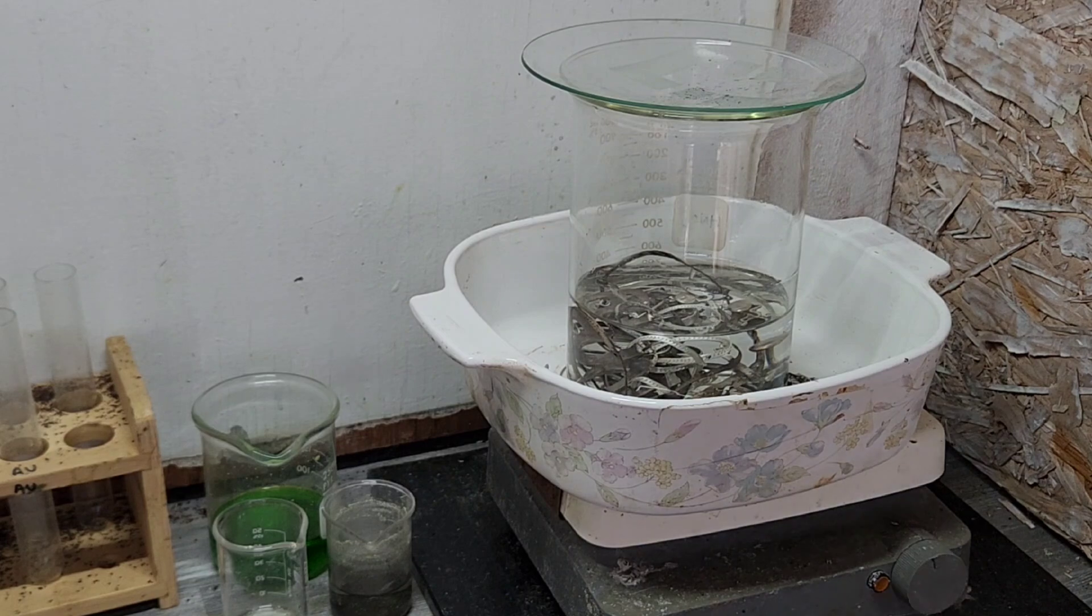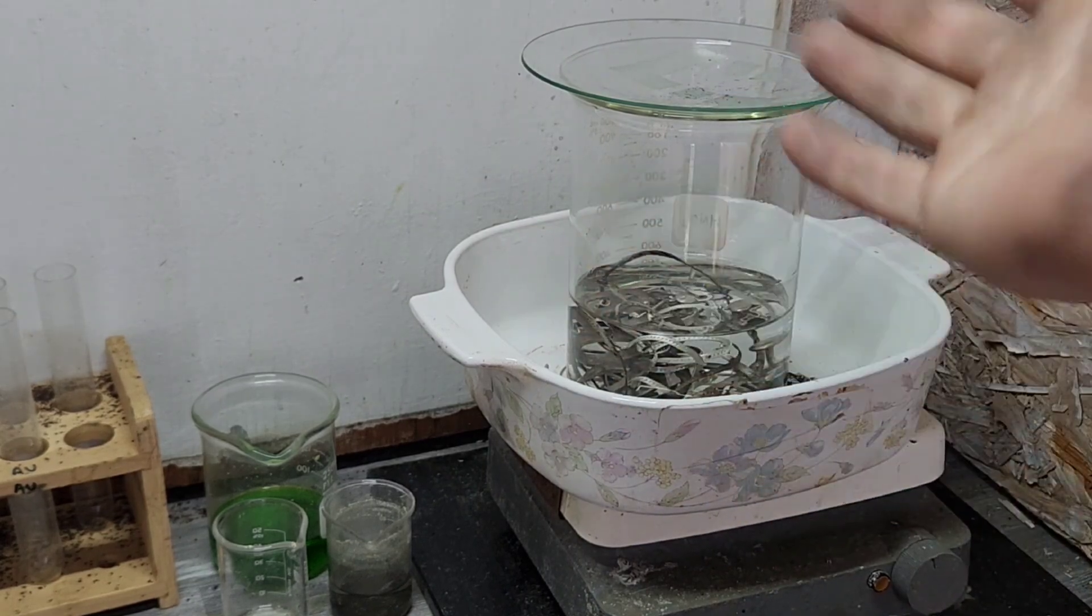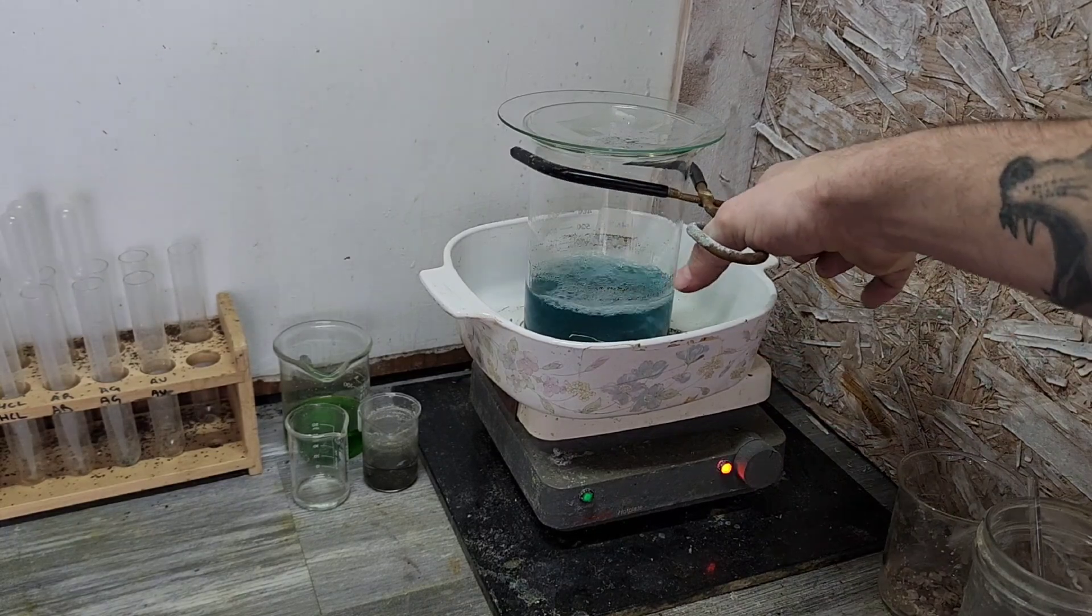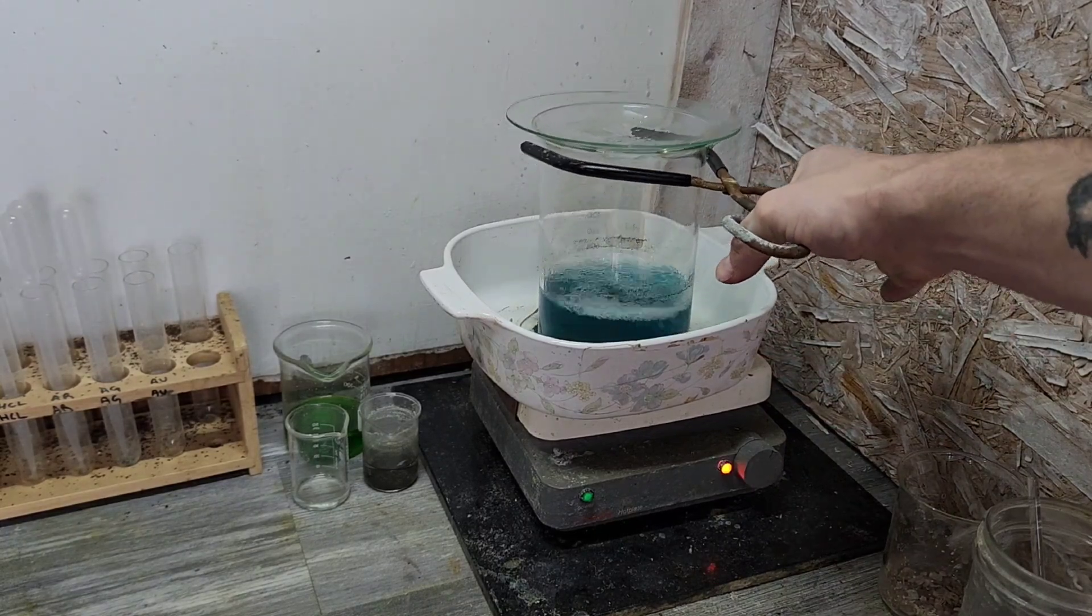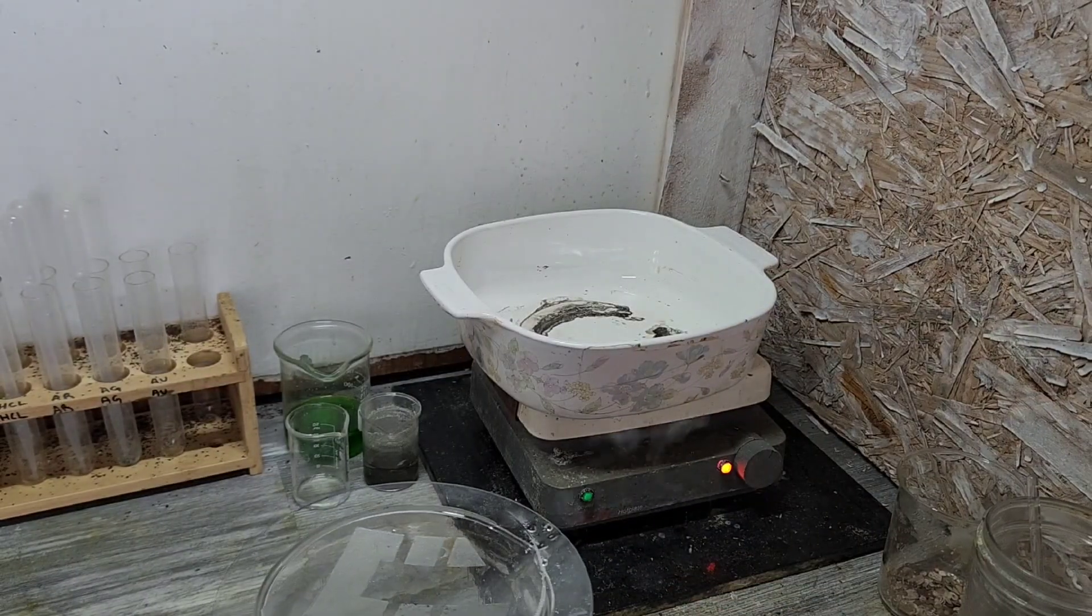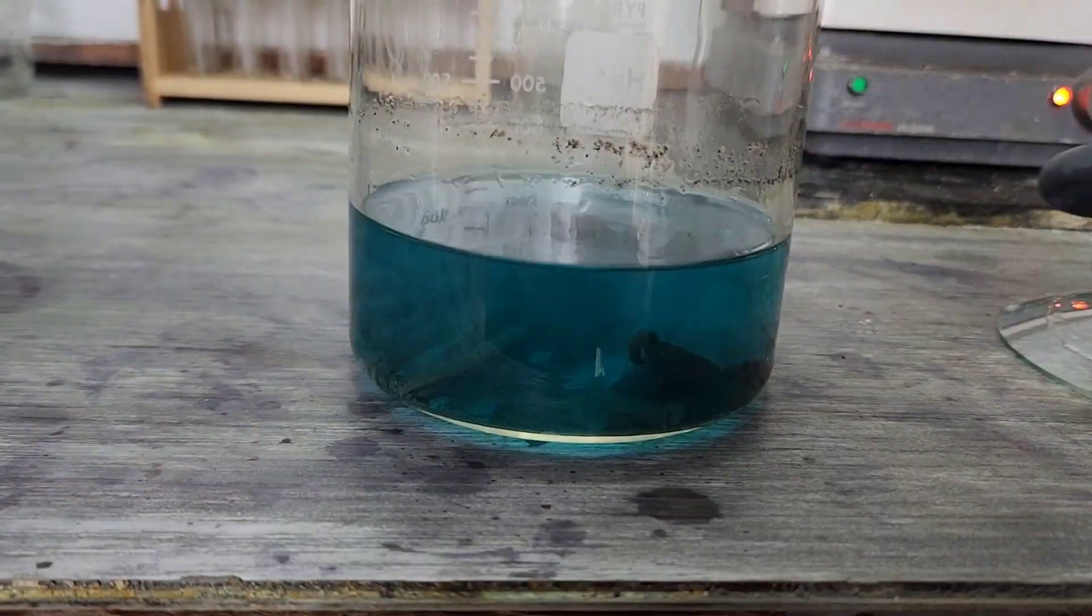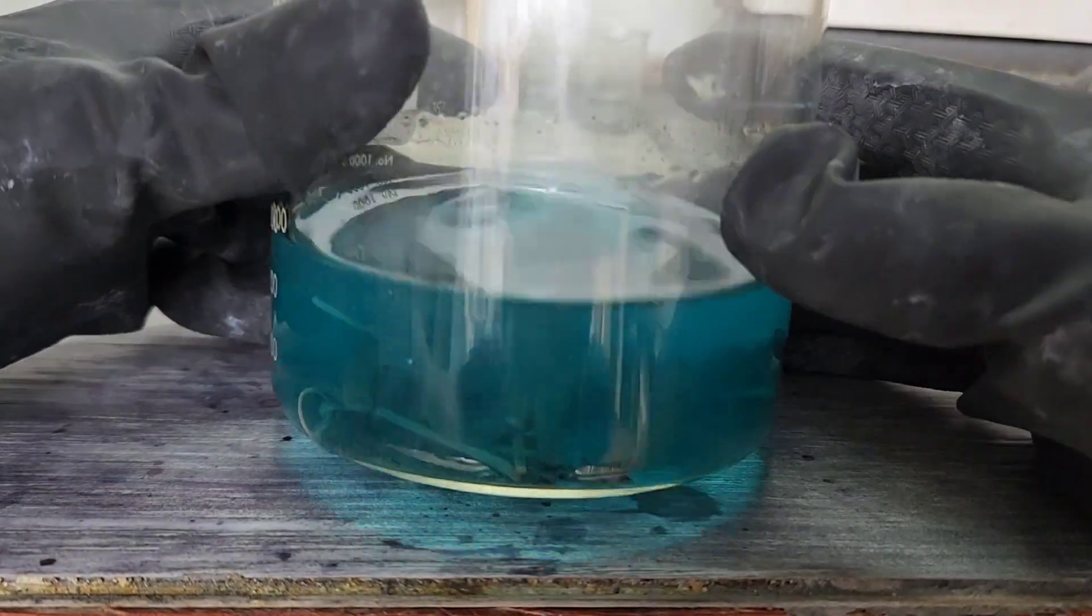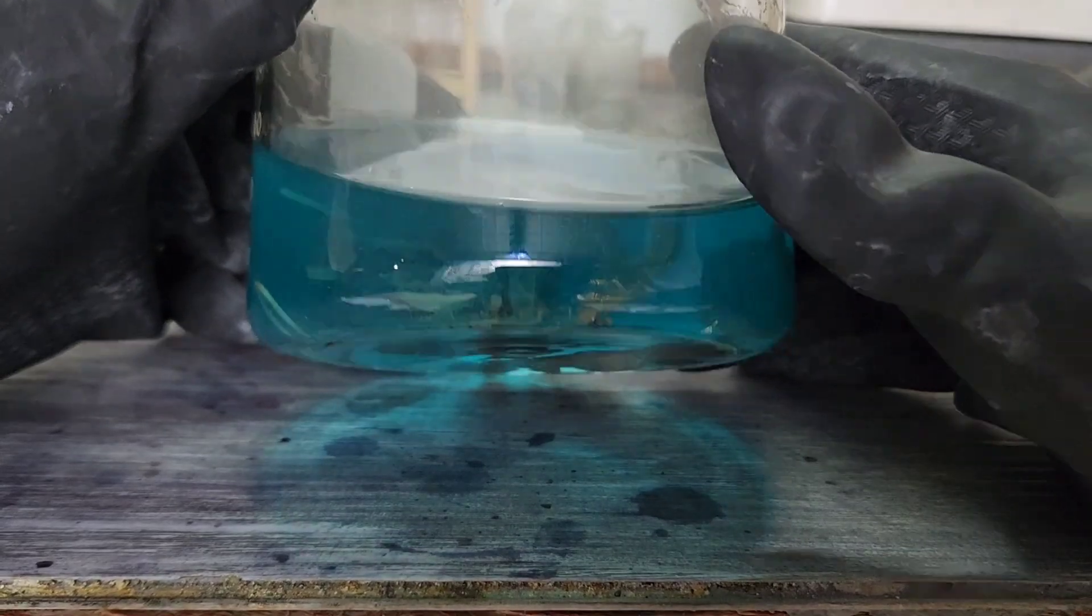All right, let's let it do its thing. Should be pretty straightforward. I probably just jinxed it. That epoxy is gonna go crazy now. Well, we'll see. Here in a minute, this reaction is done. Let's take a peek at this. Oh, we got quite a bit. There's a lot of that fun left.